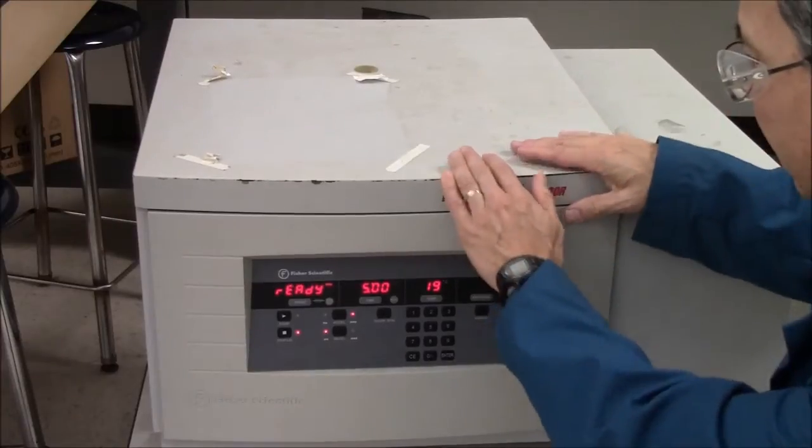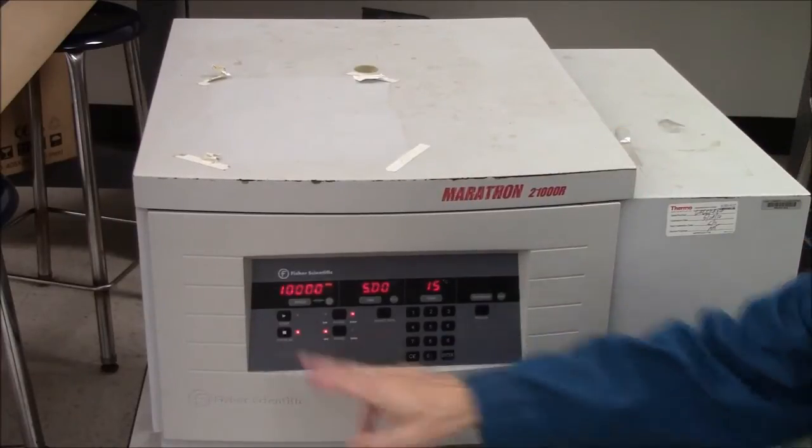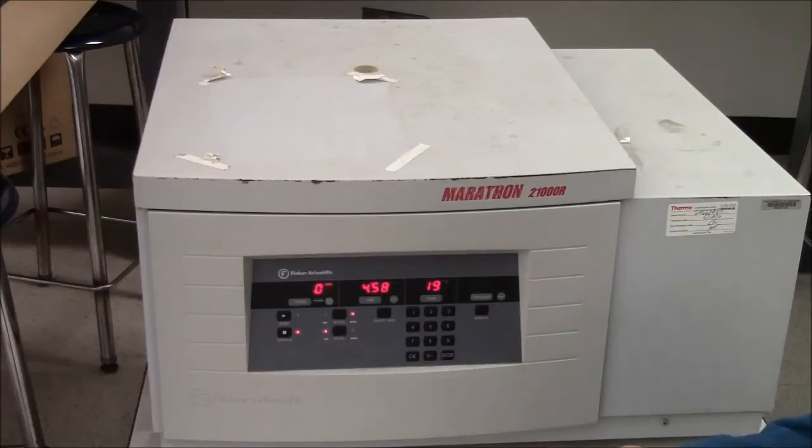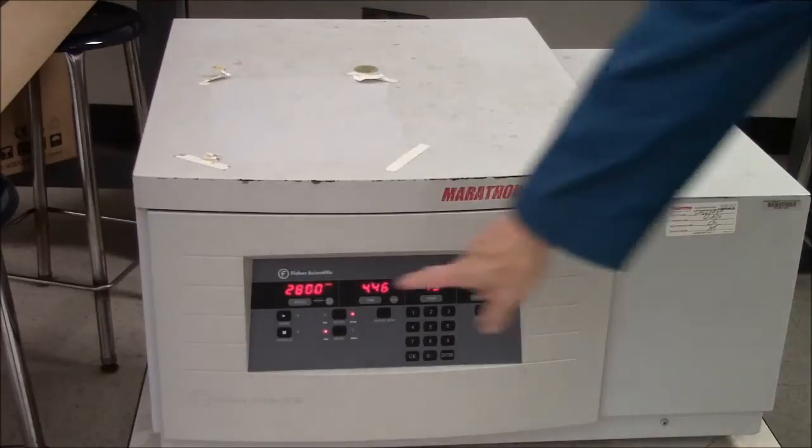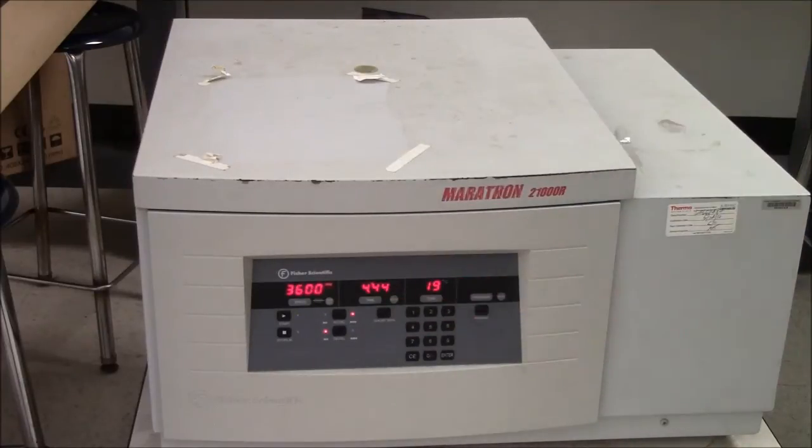Lid not closed. Try again. So here you can see the speed increasing. Timer's counting down. If I did have bacterial cells, they would be plastered to the bottom of the tube by the end of this time.